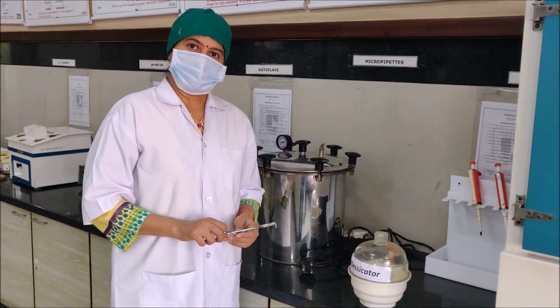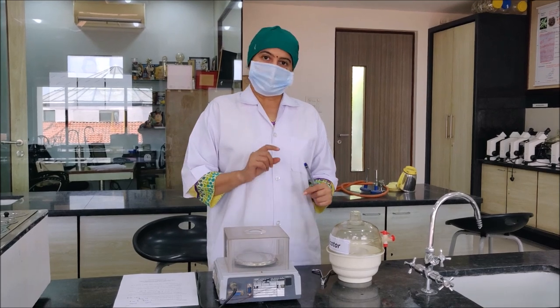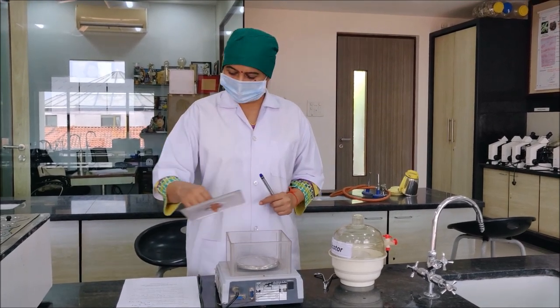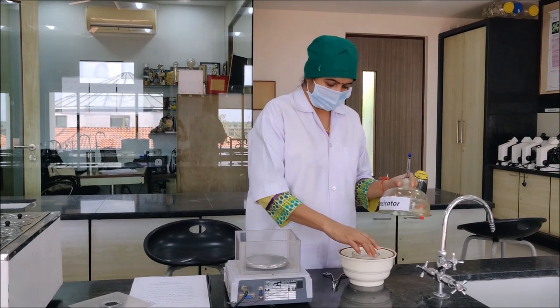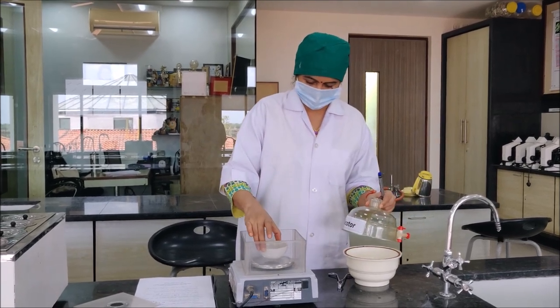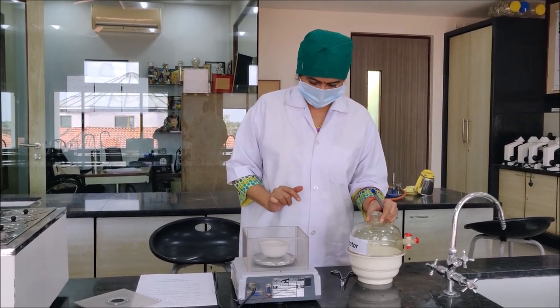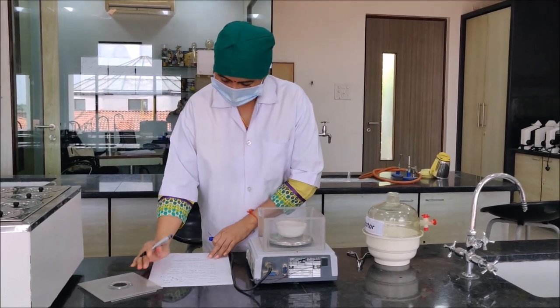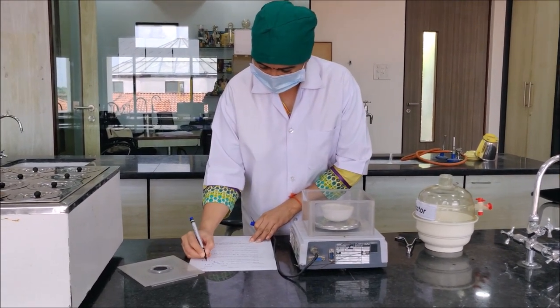After this we will be weighing it. So 30 minutes are completed. Now we are going to weigh the dry extract along with the porcelain dish. It is coming as 81.16 grams.